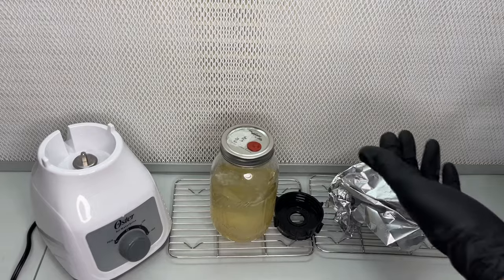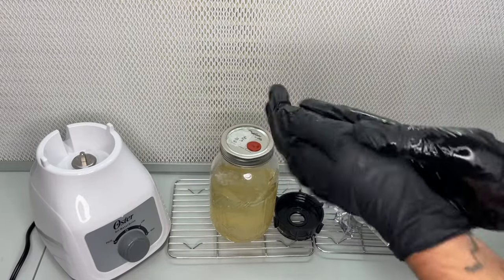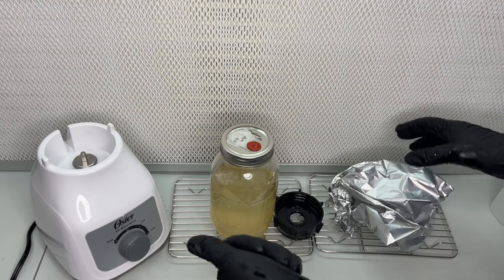After it has cooled down, you can wipe everything with isopropyl alcohol and then you can attach the blade to the liquid culture jar.